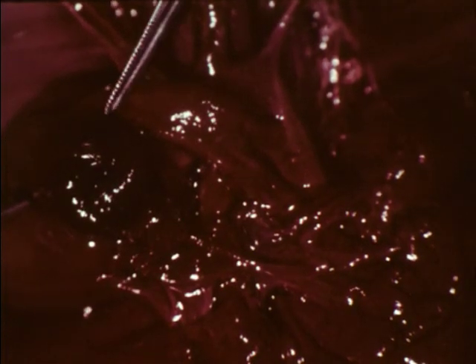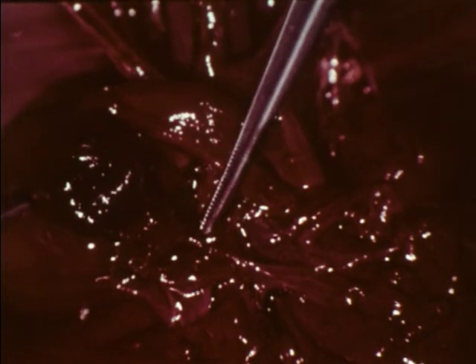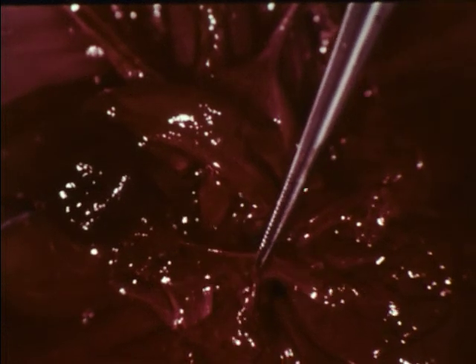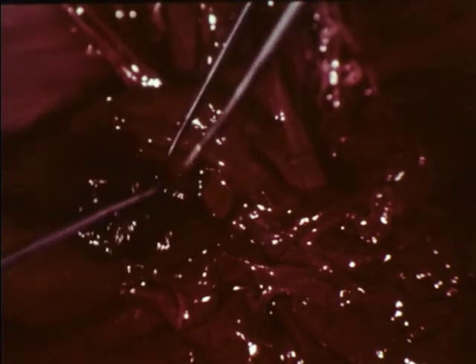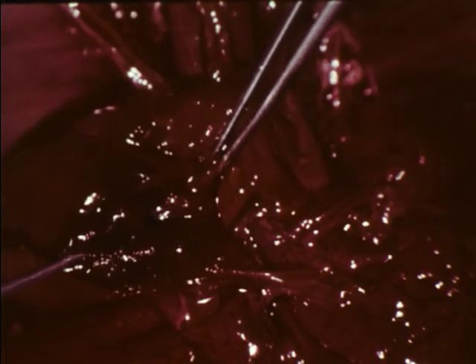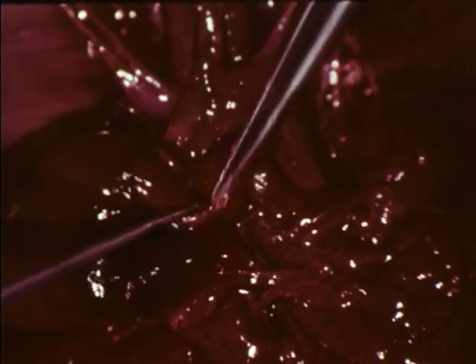We will examine the circulation of the blood as it occurs after the mammal is born. The right ventricle pumps the blood through the pulmonary trunk and pulmonary arteries to the lungs. Here, carbon dioxide is exchanged for oxygen. Then the oxygenated blood flows through the pulmonary veins and enters the left auricle. The left ventricle pumps the oxygenated blood through the large systemic trunk, from which branches are distributed.